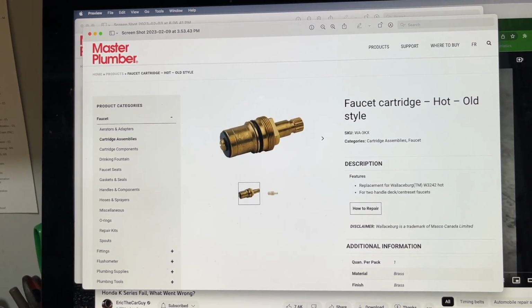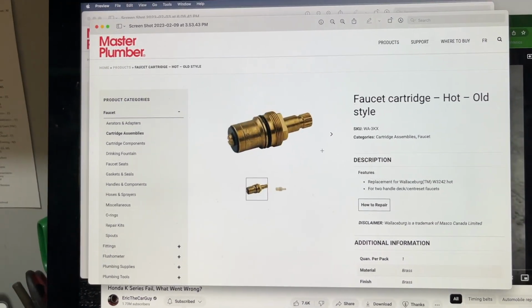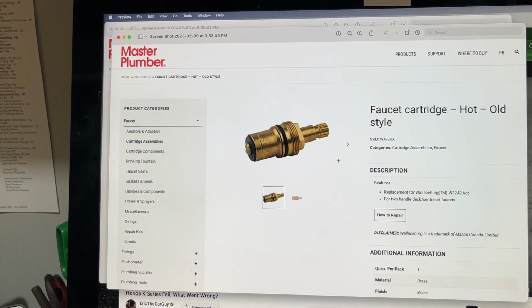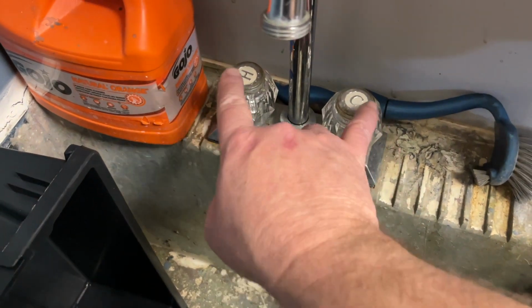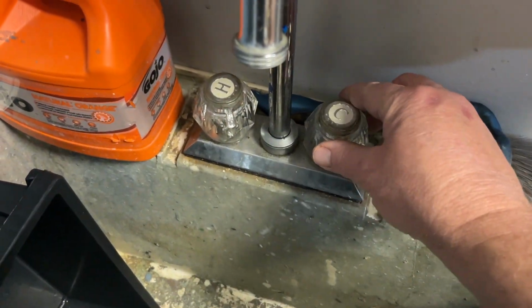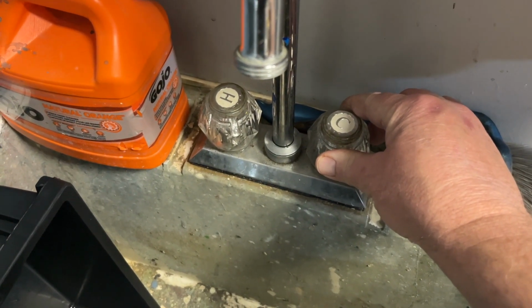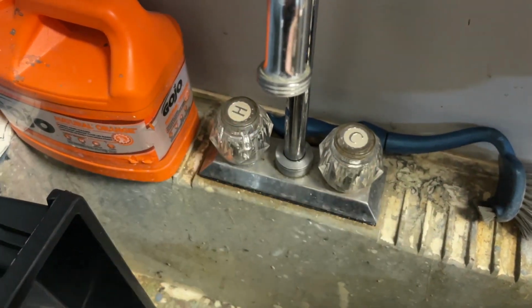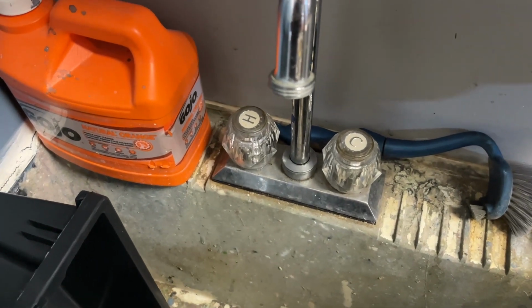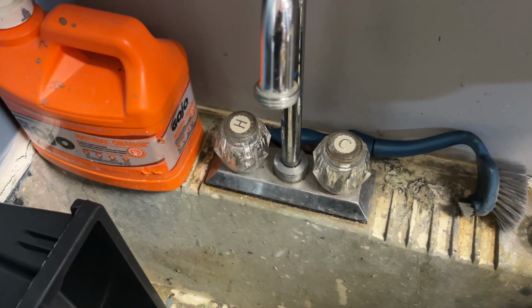I'm just happy that I found something that actually works. The type of faucet that this is designed for is something more like this, really, with a different spigot on it. Not a science lab faucet at all. So I'm just very happy that by doing an image search, I was able to find a matching cartridge. Having said all that, whether I have to turn it to the left or to the right, I don't care. At this point, we've got the faucet working again. It's not leaking. It's a win.